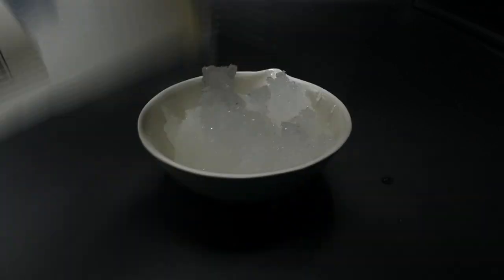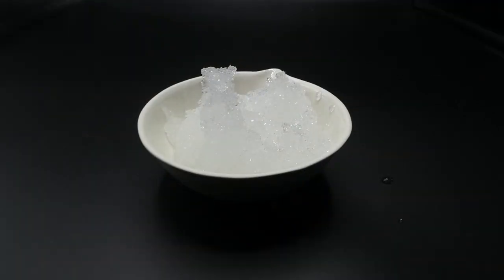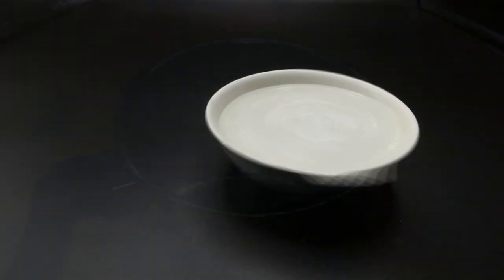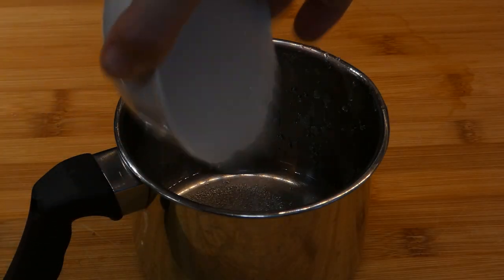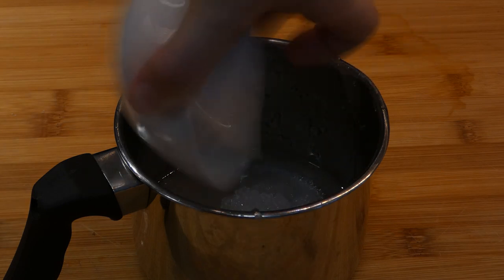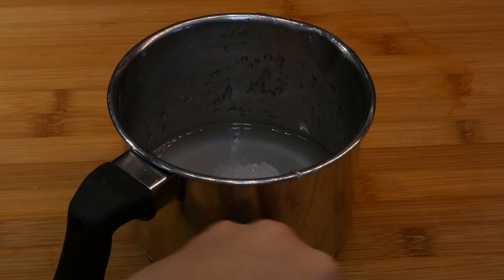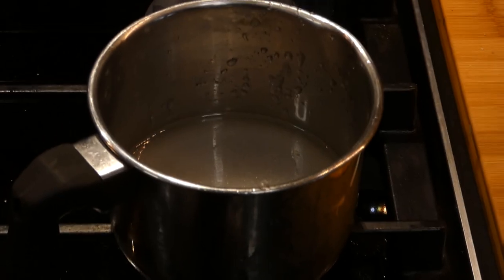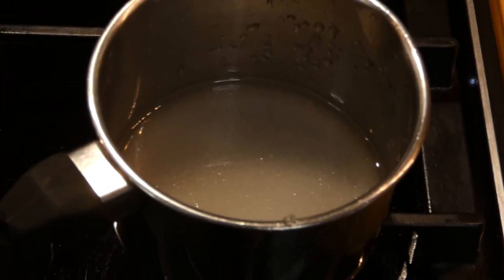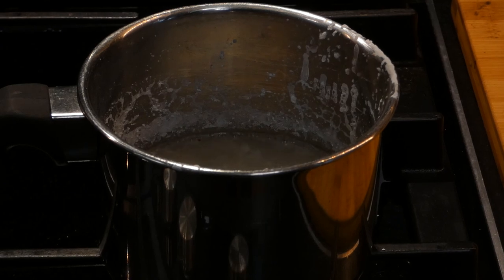The first step is to get some magnesium chloride bath salt and pour around 300g of it to a dish. Then transfer the bath salt to a pot and start boiling. If your bath salt is old and was kept in a wet environment, it is going to be very wet. This is happening because the magnesium chloride attracts water molecules and chemically bonds with them becoming a hydrate. The boiling process gets rid of most of the water and leaves behind chemically dry chloride which we can use as a drying agent for our desiccator.